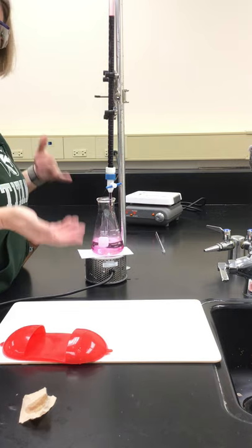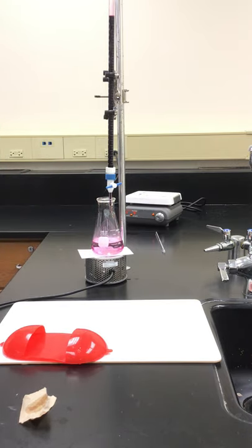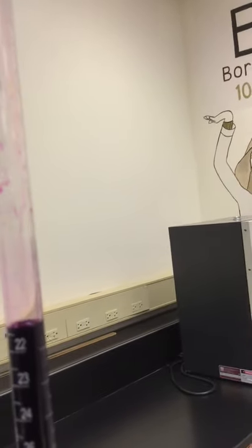Now I'm going to get my camera over here for you guys so you can see. Here's our volume reading at the end. Let me get that piece of paper here so you guys can see it.